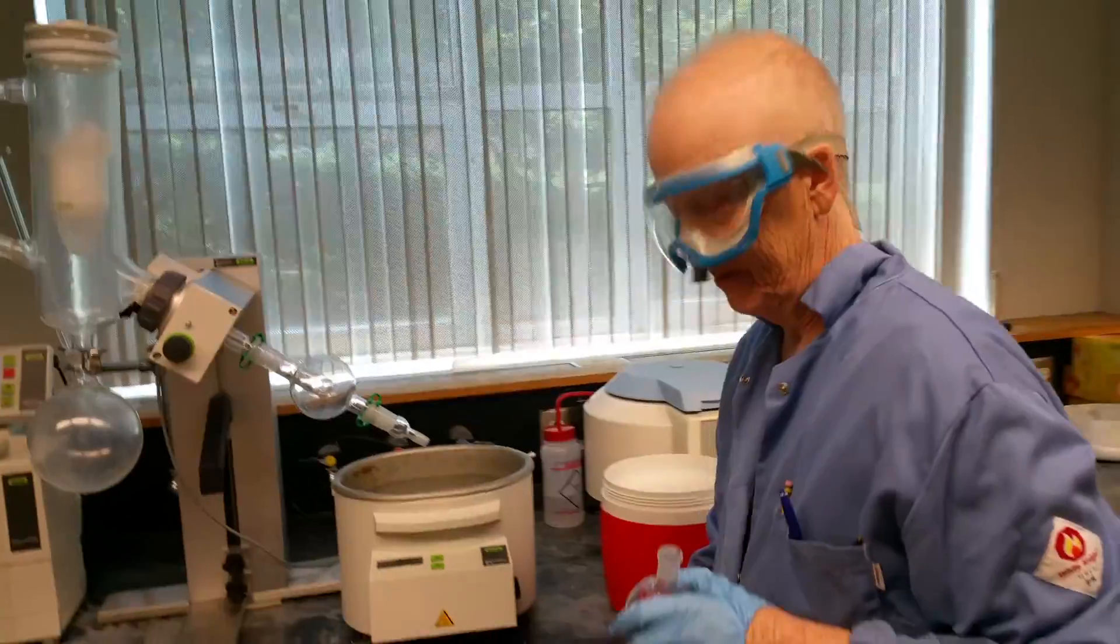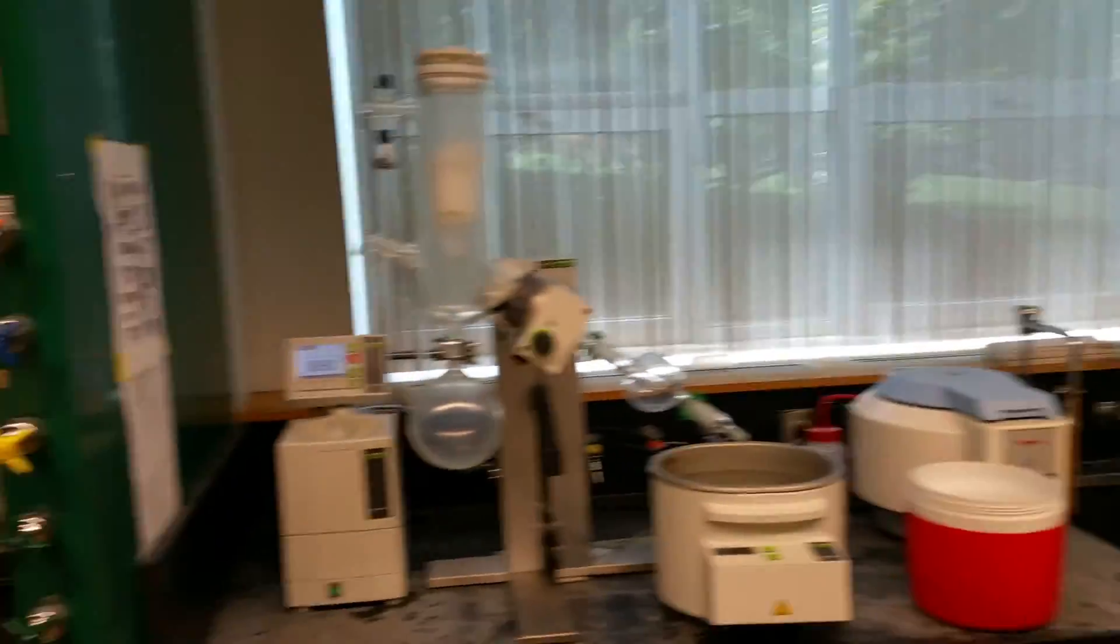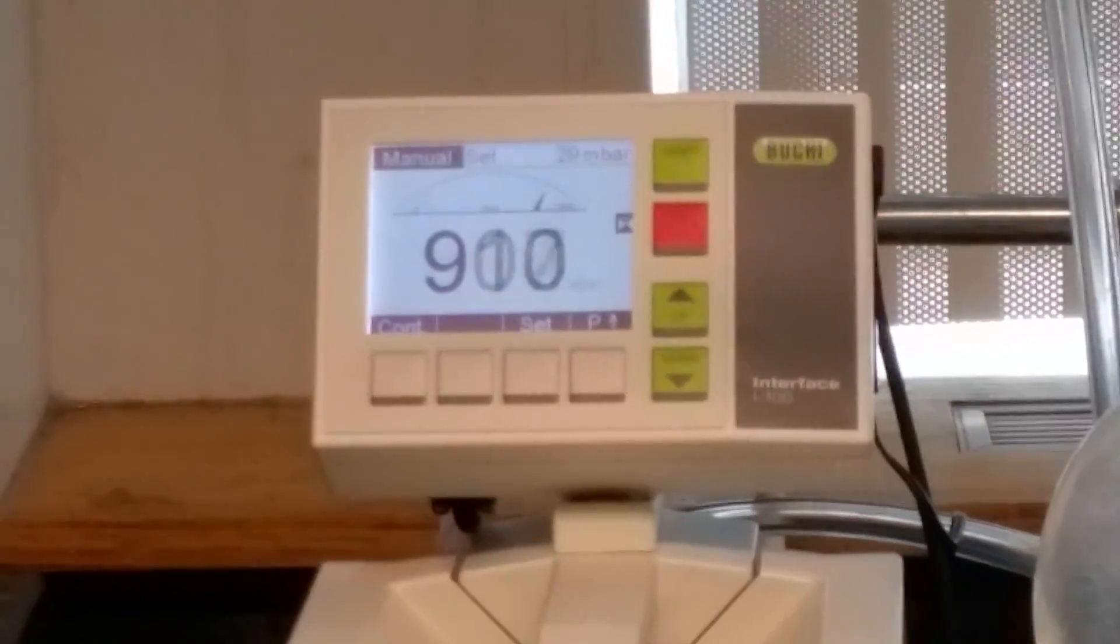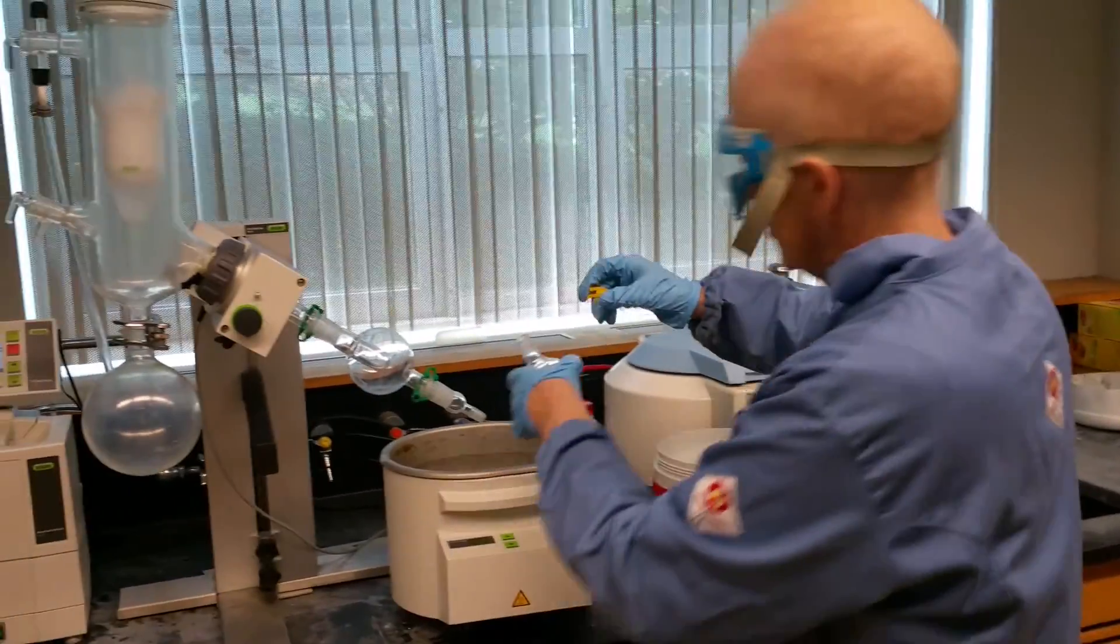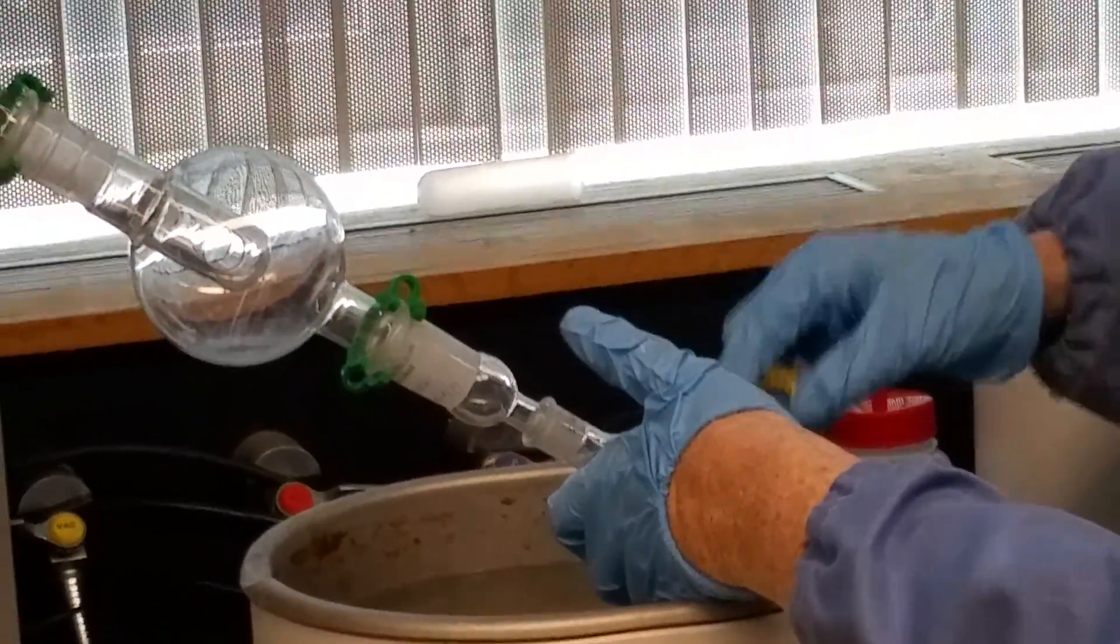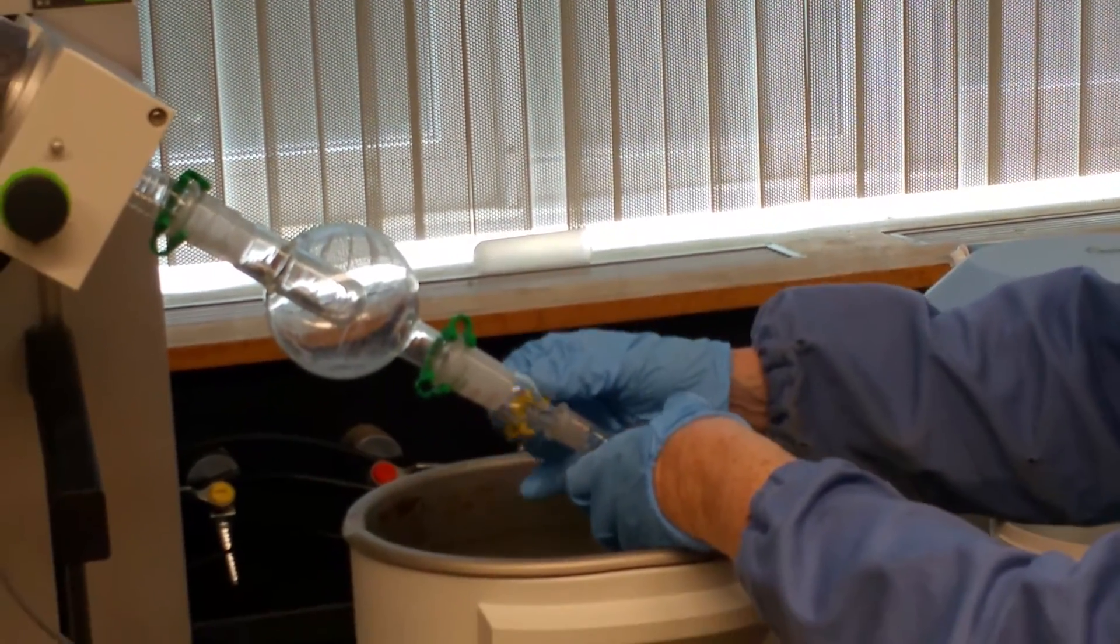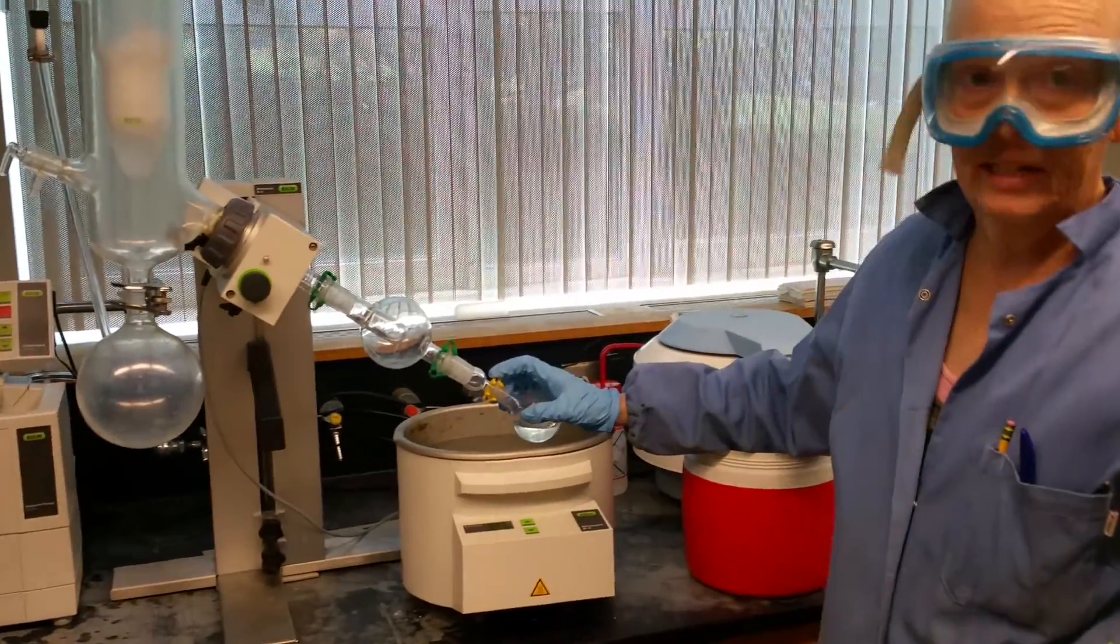What am I going to do with this? I'm going to grab a clip. So our videos are very casual. I'm taking my round bottom that has the liquid in it, and I want to get rid of the acetone and get the organic solid.